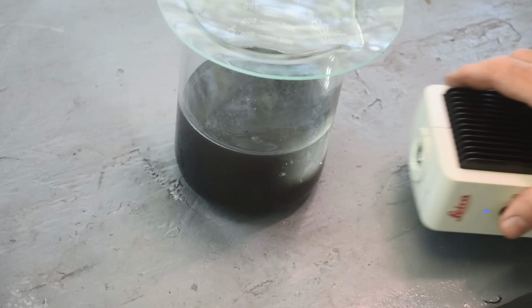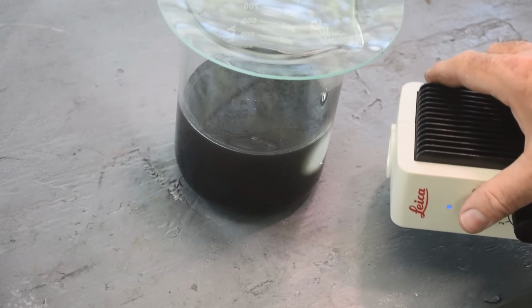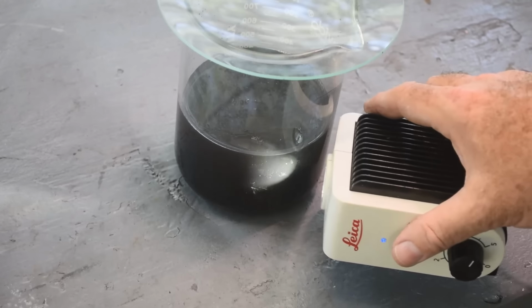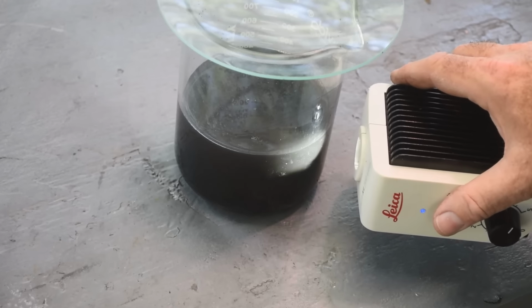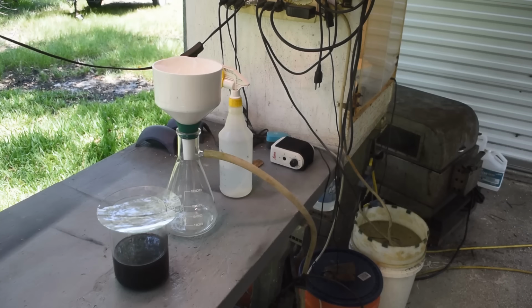I mean, this stuff's totally opaque. You can't see into it. I don't know what's going on with it, but it is not settling. Not after more than 24 hours. All right, so what's plan B?